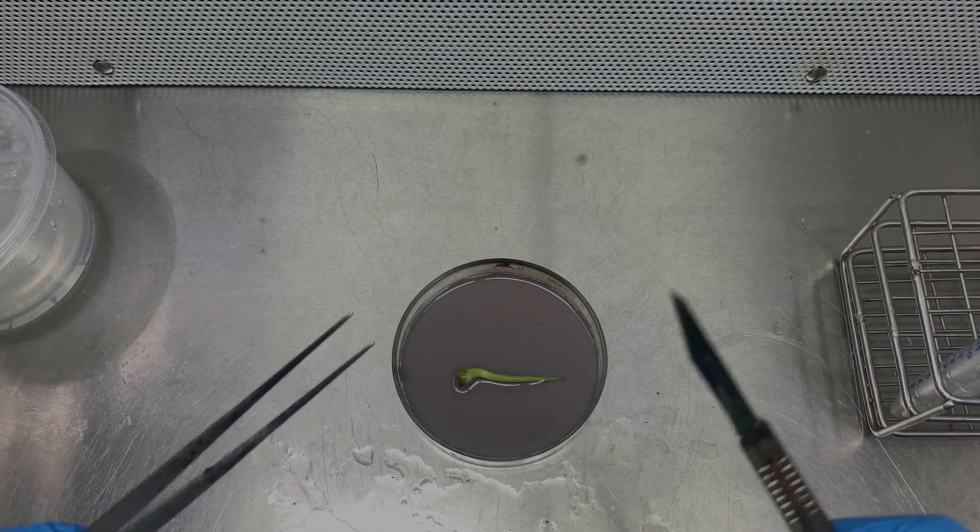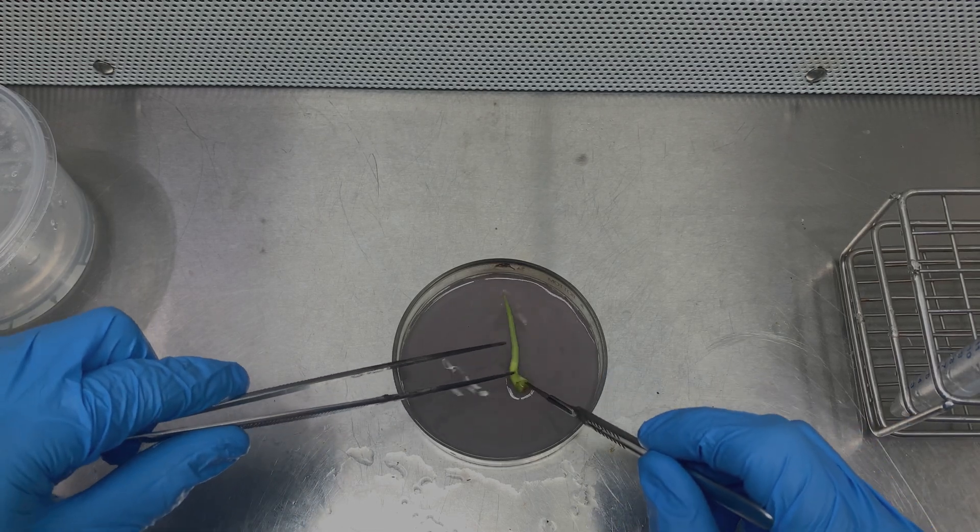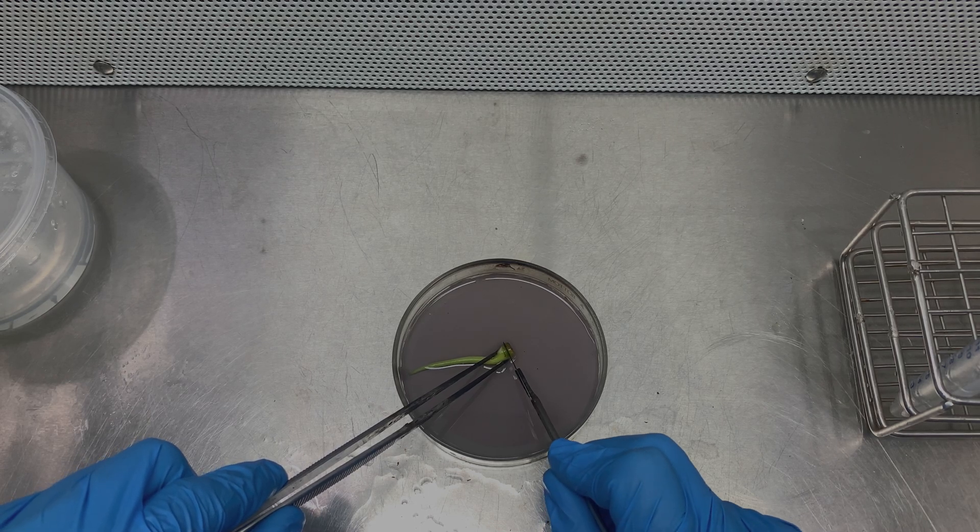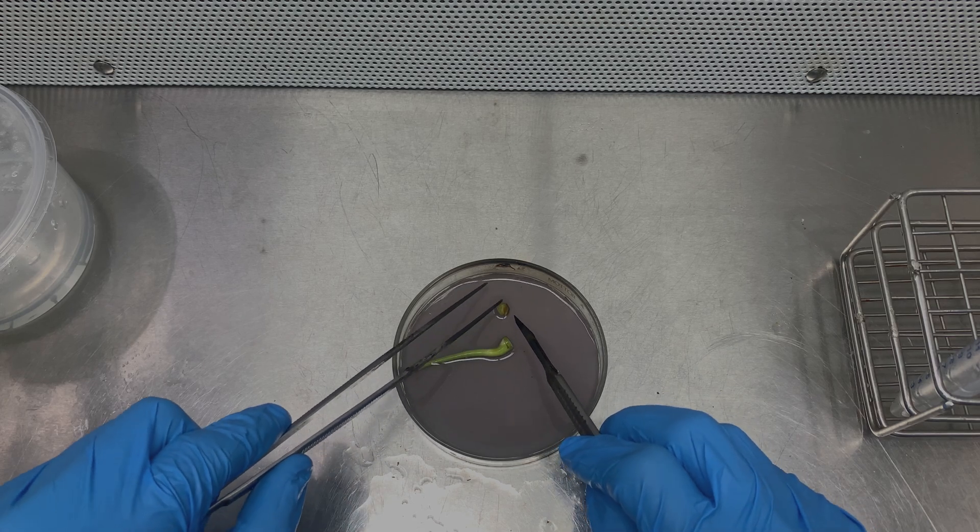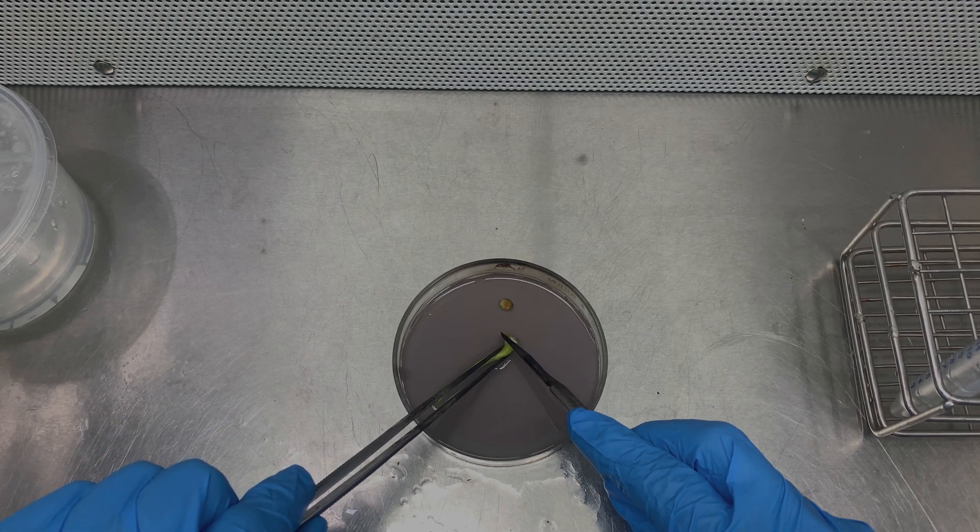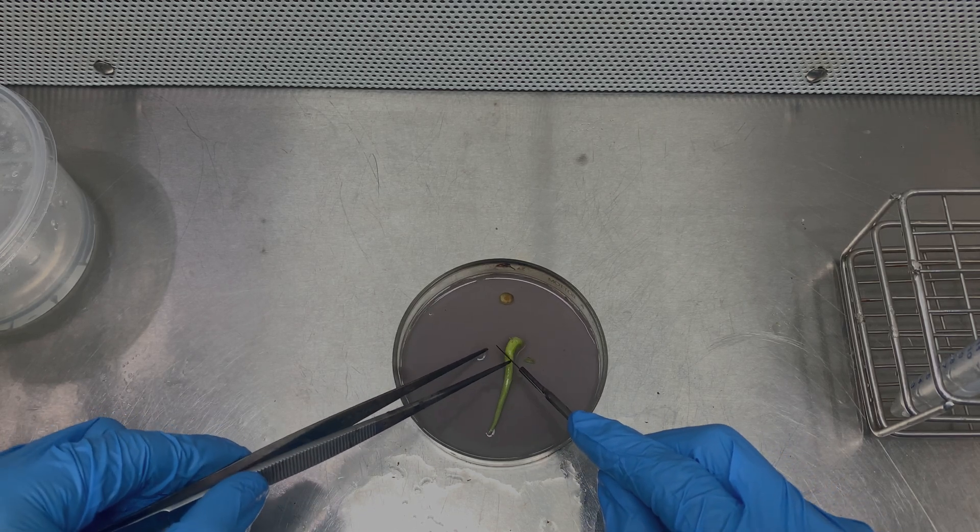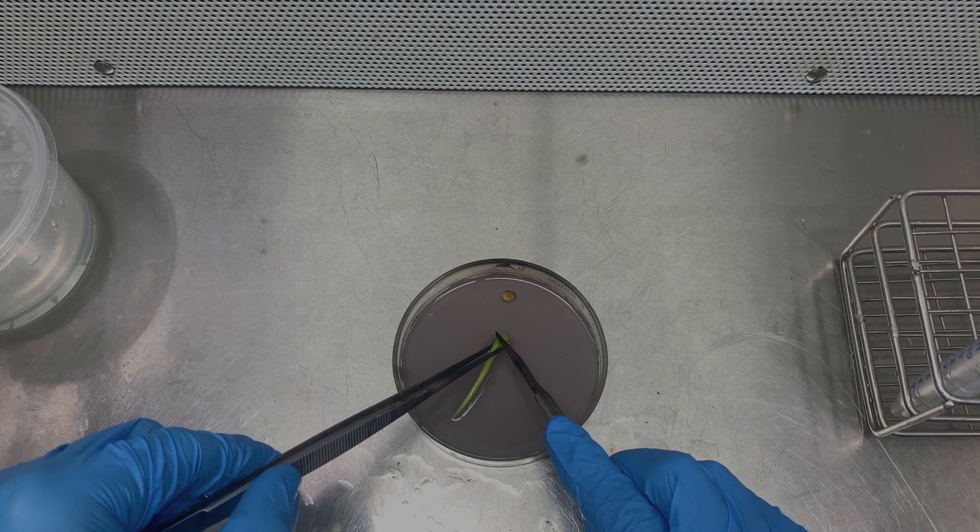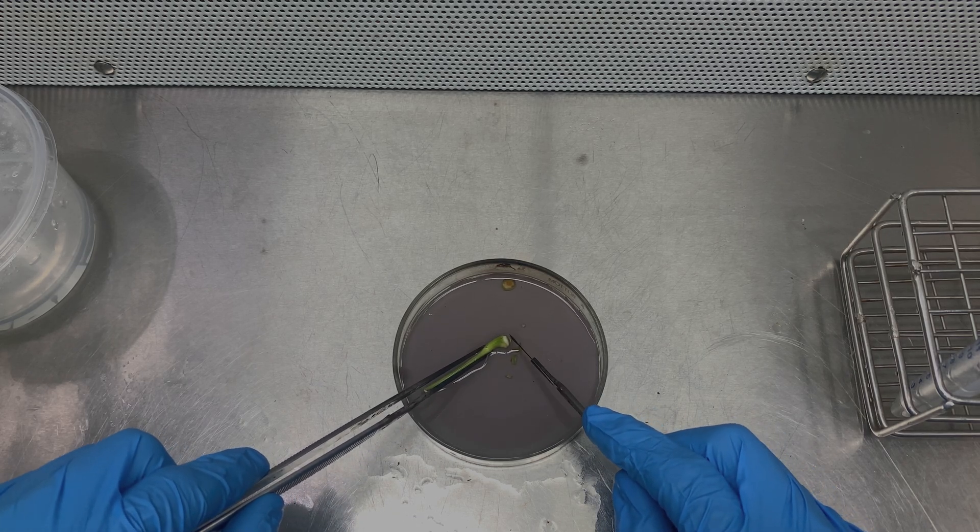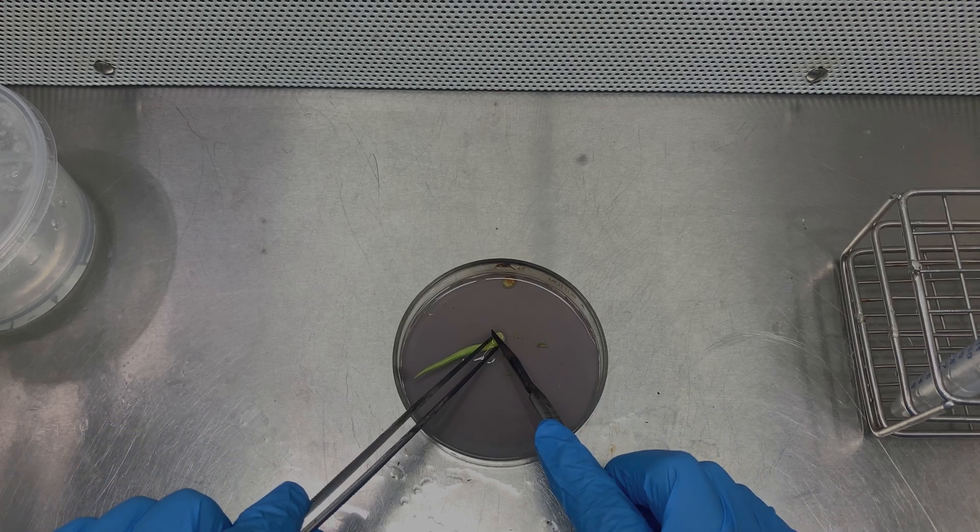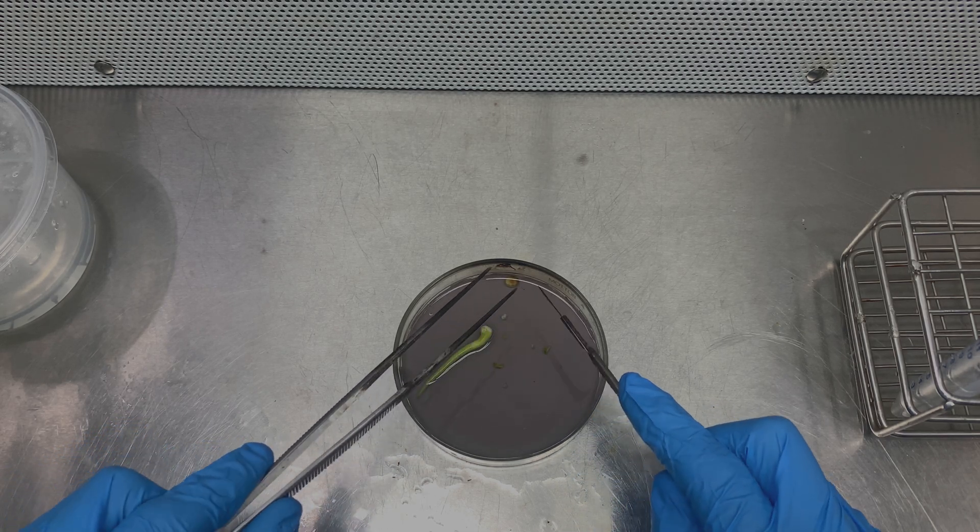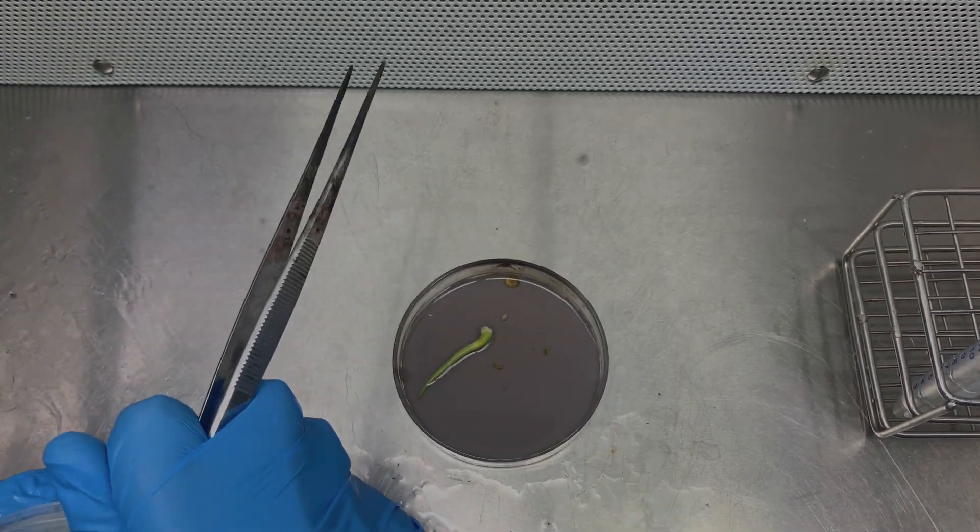I want to grab my sterile forceps and my sterile scalpel. I want to cut the very end because it has been sterilized, so I don't need it. I'm just going to let it out.